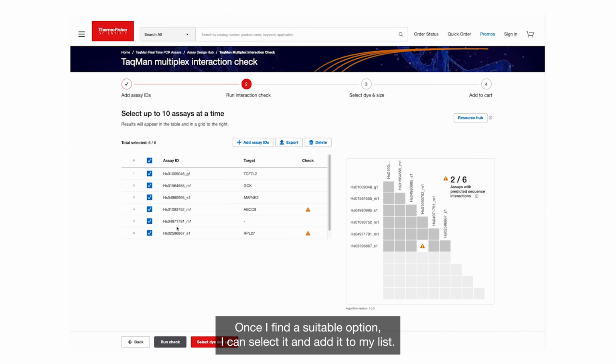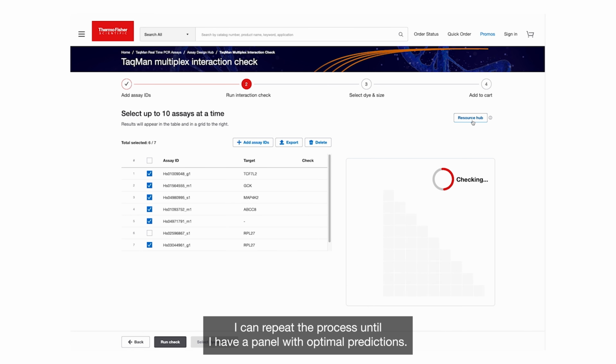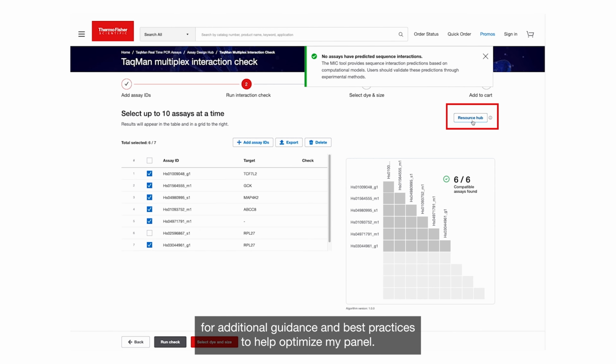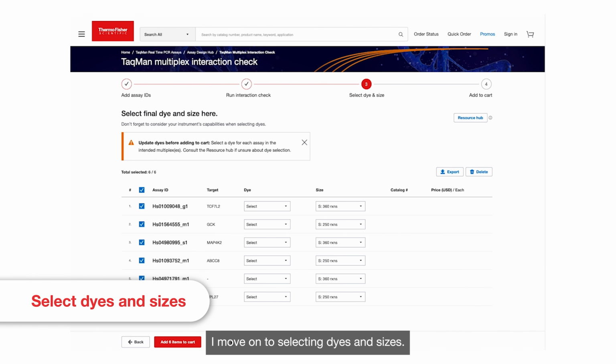Once I find a suitable option, I can select it and add it to my list. I can repeat the process until I have a panel with optimal predictions. I can also visit the Resource Hub for additional guidance and best practices to help optimize my panel. Once I'm satisfied with the panel, I move on to selecting dyes and sizes.